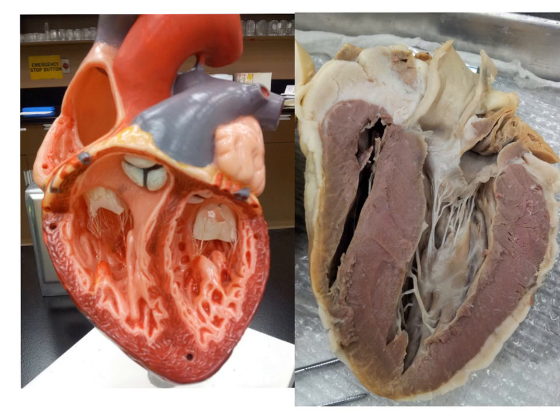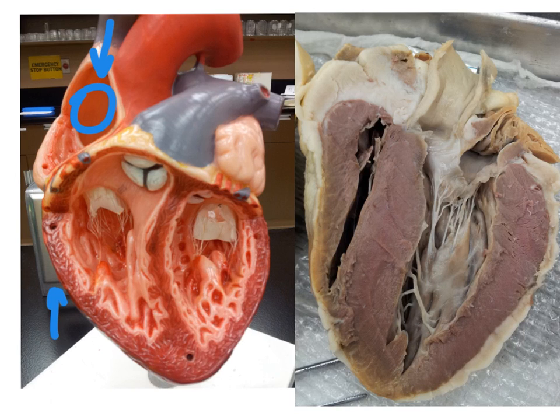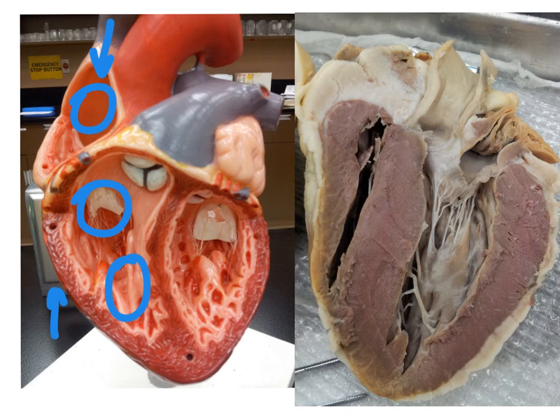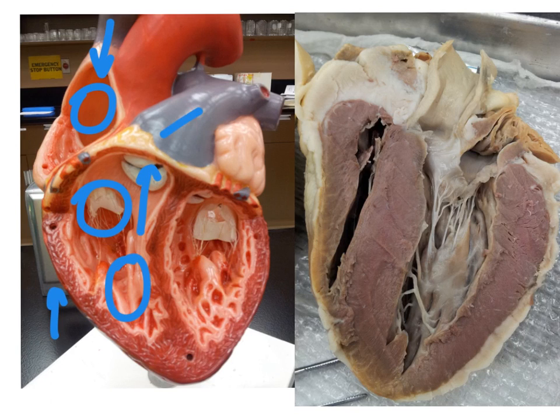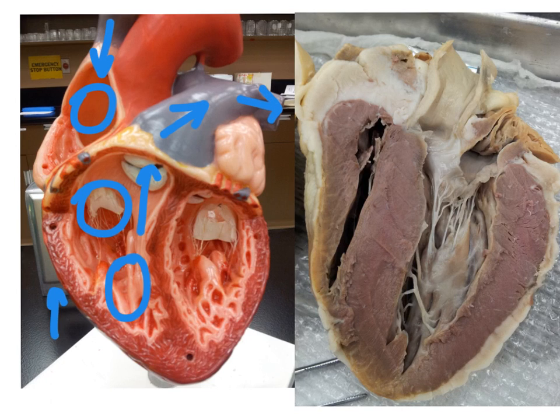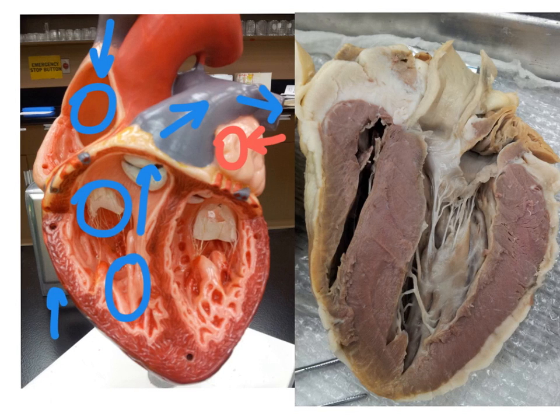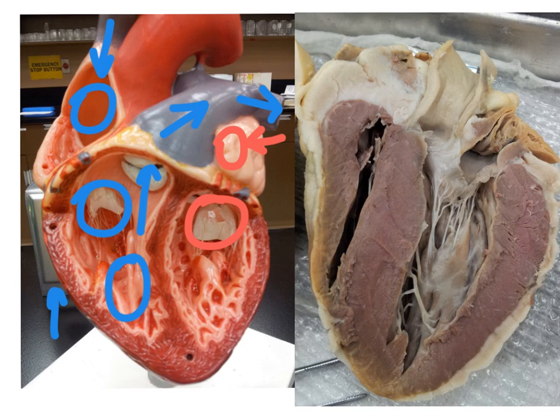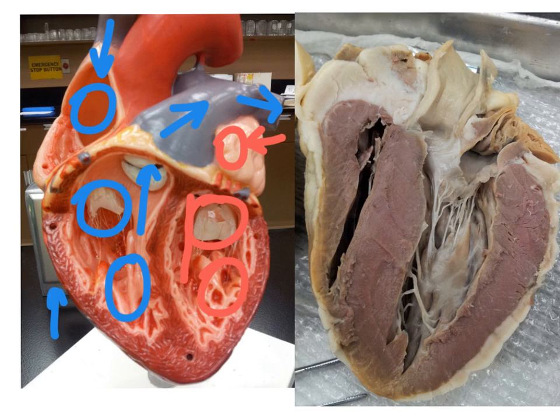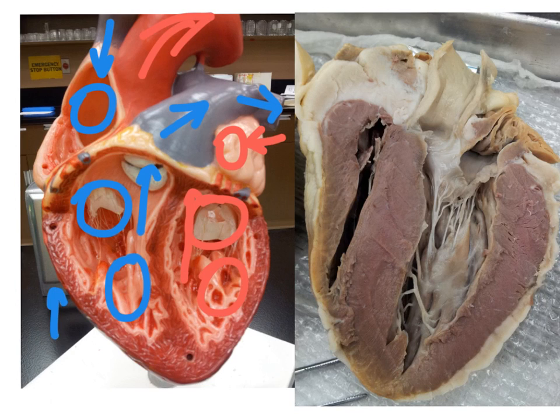In summary: superior and inferior vena cava to the right atrium, through the tricuspid valve into the right ventricle, out the pulmonary semilunar valve to the pulmonary trunk and to the pulmonary arteries. Oxygenated blood returning via the pulmonary veins into the left atrium, through the bicuspid or mitral valve into the left ventricle, and then up and out the aortic semilunar valve and then out the aorta.